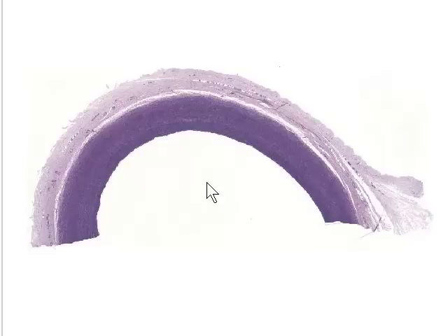This time around you need to pay attention to the fact that there are three layers in the wall of the aorta. Tunica intima, which is the layer closest to the luminal surface. The arrowhead is going around the luminal surface just now, and we can't really make out a clear distinction between the tunica intima and the middle layer, the tunica media, which is this layer here at this magnification, although I can see just a slight discontinuity in staining along here that indicates where that boundary is.